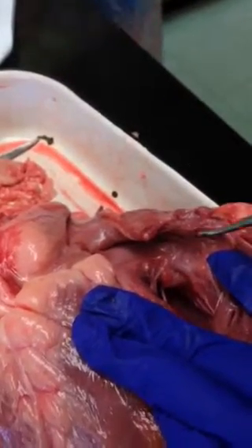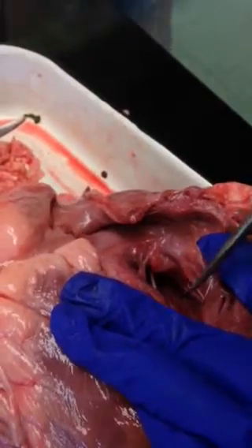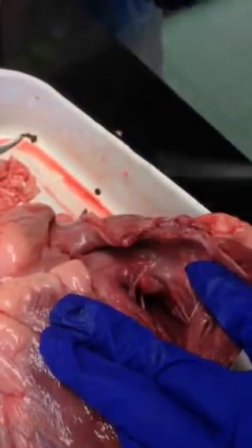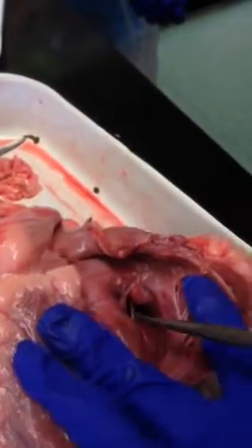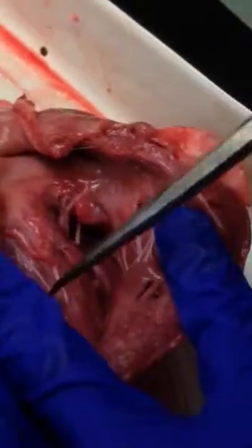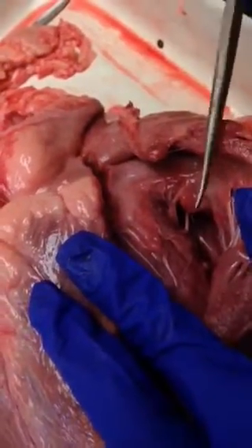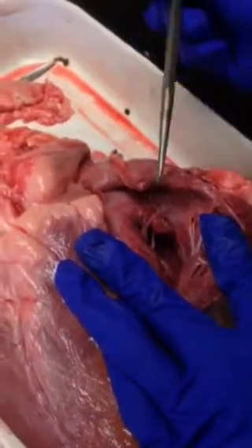So another important structure to understand from the right atrium is the tricuspid valve, and the tricuspid valve is responsible for facilitating the flow of blood into the right ventricle. It's called tricuspid clearly because there are three parts to it, and you can see one part here, and one part over here. And if the heart wasn't cut open, those three parts would be connected and prevent blood from flowing backwards back into the right atrium as it goes into the ventricle.